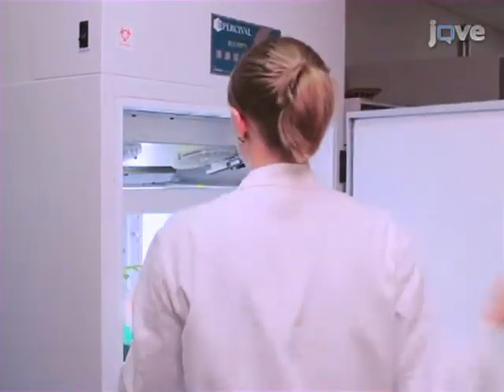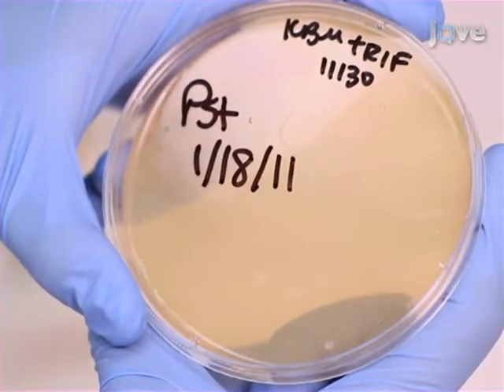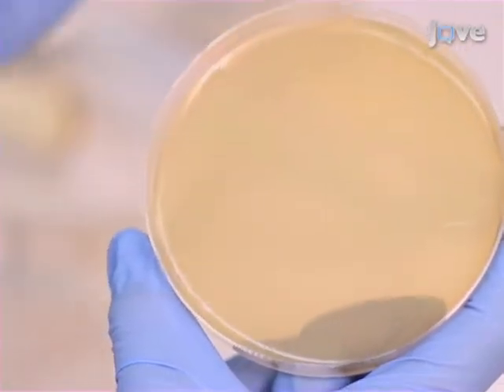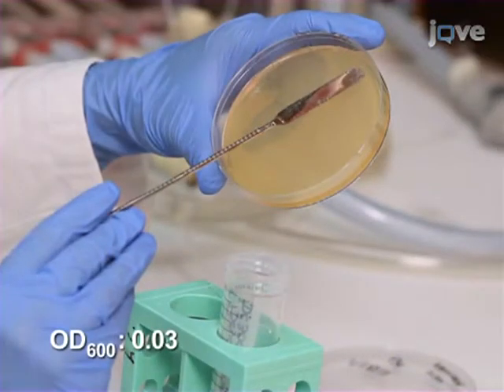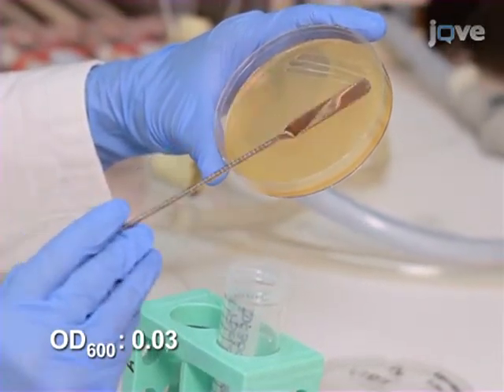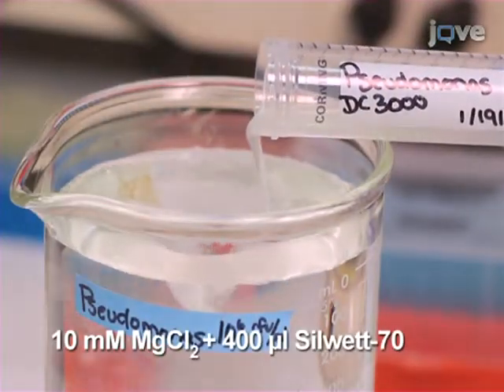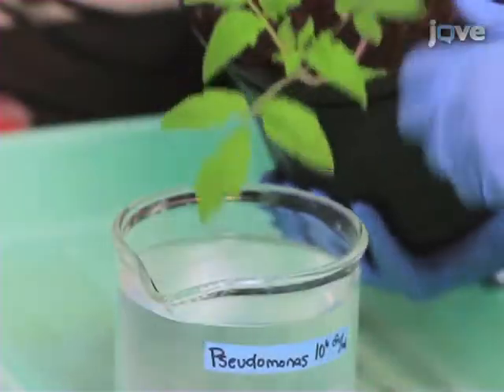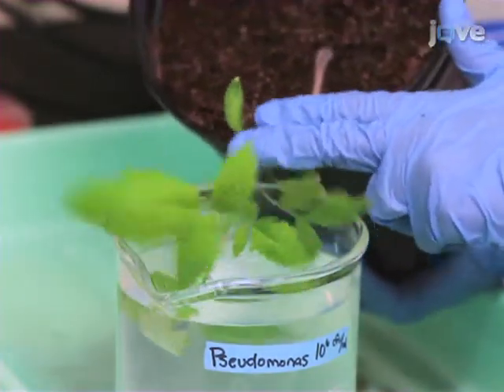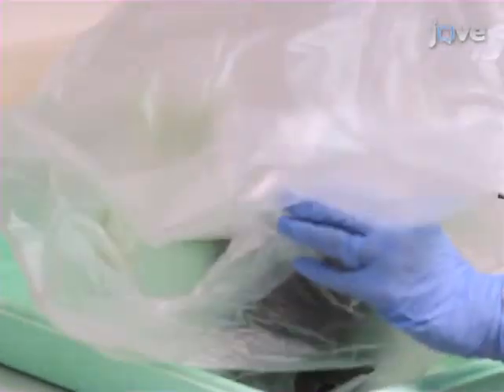Grow 2 transplanted tomato seedlings of similar size in 4-inch diameter pots. For the inoculum, culture a lawn of Pseudomonas syringae on a KBM plate. Scrape the bacteria into 20 ml of water and prepare a bacteria inoculum of around 10 to the 6 colony-forming units per milliliter in 1 litre of inoculation buffer. Dip the 4-week-old plants into the bacterial inoculation solution for 30 seconds. Then, cover immediately with clear plastic bags.